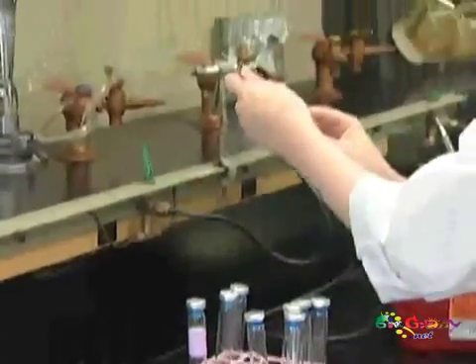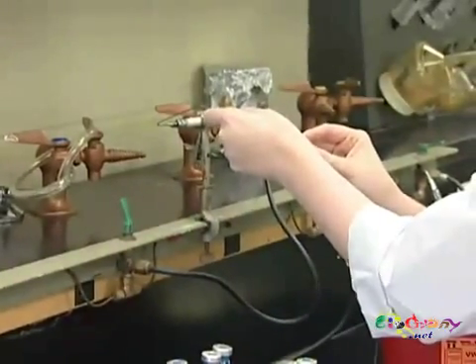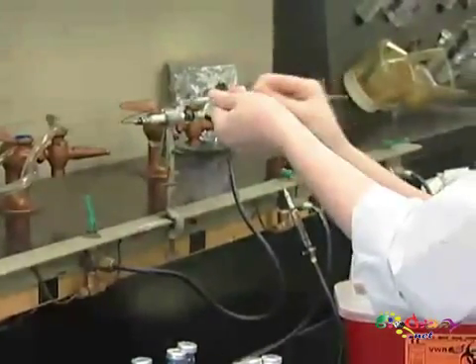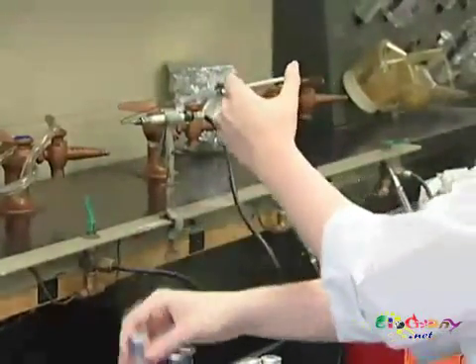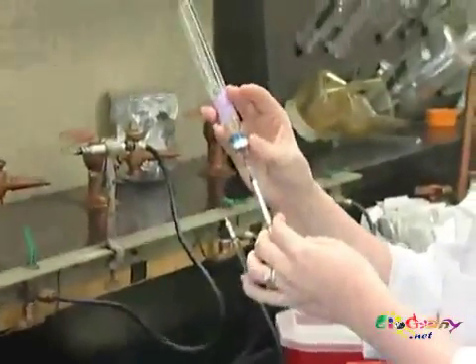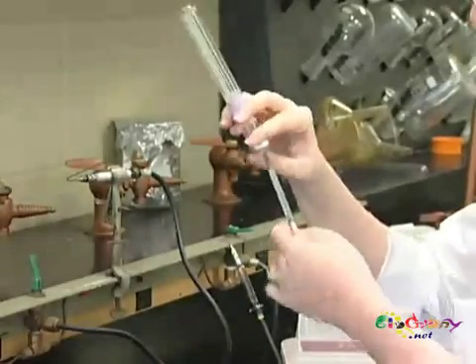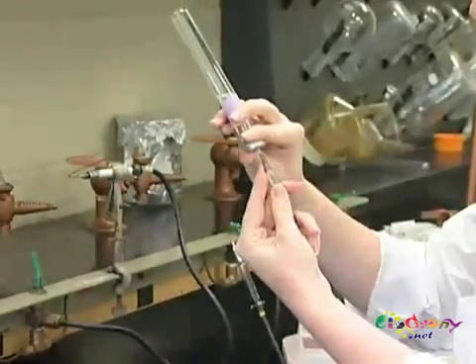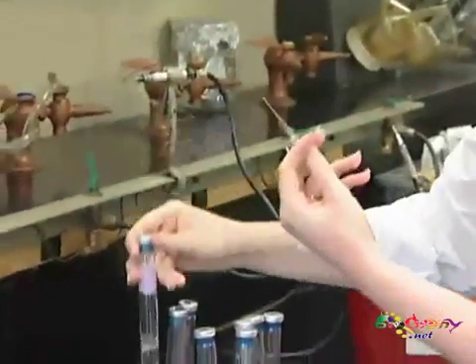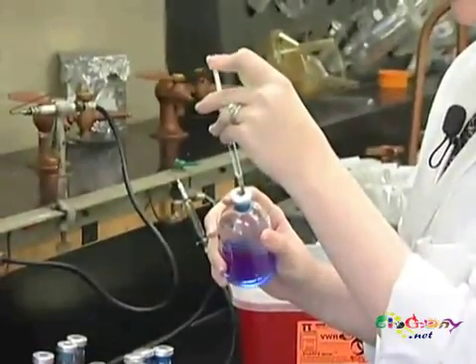Let me show you this again. So we are flushing out our syringe, and this time I'll do it with the bottle. You'll grab your sulfide — we're going to pull out more this time. Make sure you pull it out by the needle, otherwise the needle can separate. And we'll inject this into our bottle.